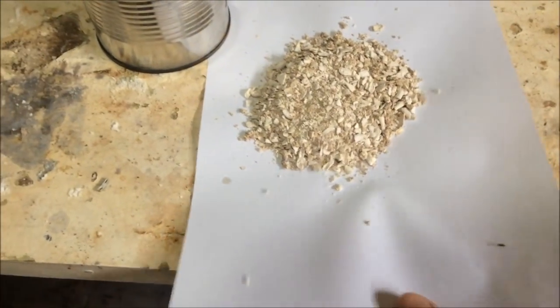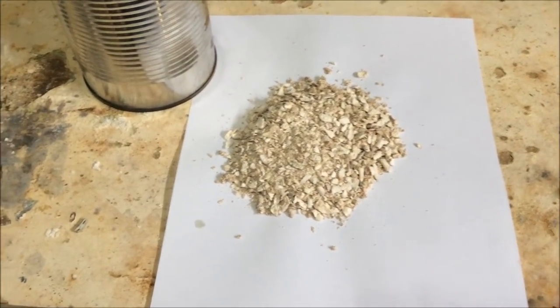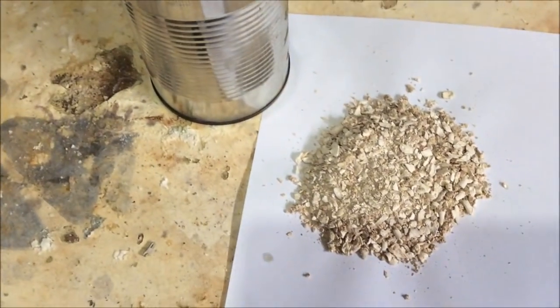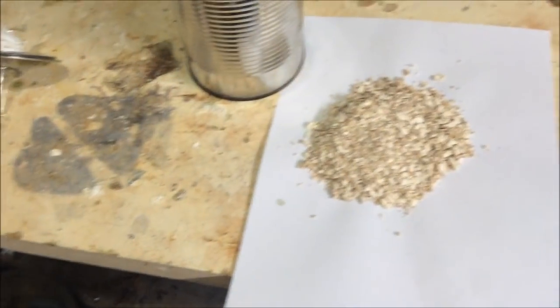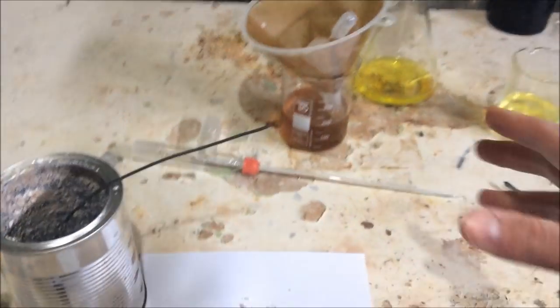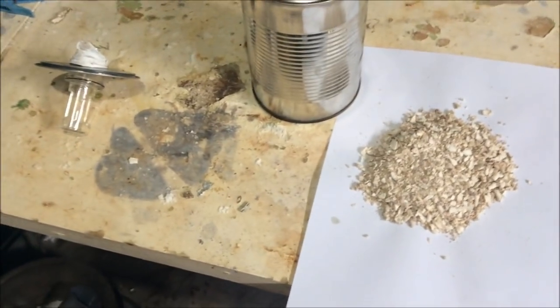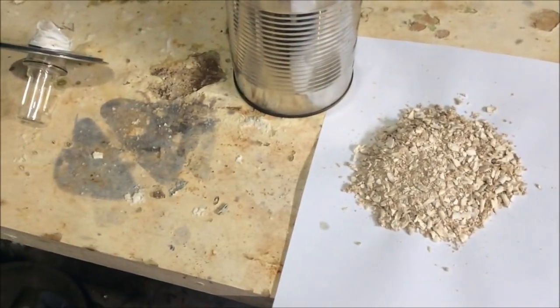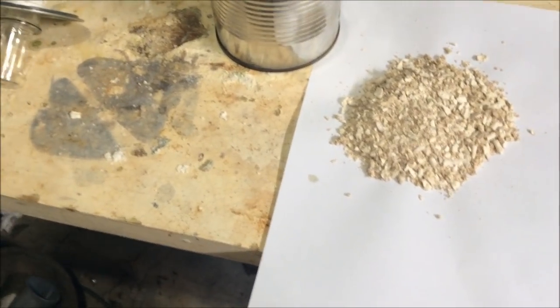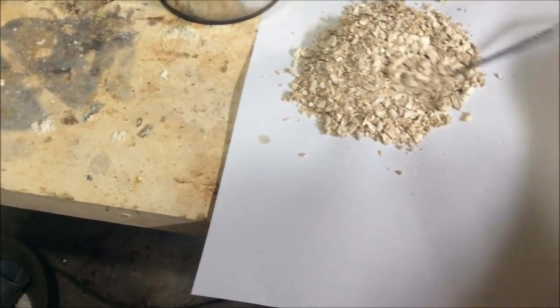Alright, so here's our dried sodium terephthalate. Obviously you can see that I charred it quite substantially on the bottom there, which will likely affect the yield at the end. Probably not by much, but by a measurable amount. To be honest, the way I did it, where I decanted off most of the ethylene glycol and then just heated it to drive off the rest, was a bad way of doing this. I really should have put it in the filter paper, got all the ethylene glycol out, but then washed it with a more volatile solvent like ethanol or even toluene, so I didn't have to heat it up to 200 degrees to dry it. We'll know for next time to do it the conventional way: wash it with the volatile solvent and let it dry. But anyway, this hopefully will still work, so we do have our dried sodium terephthalate.